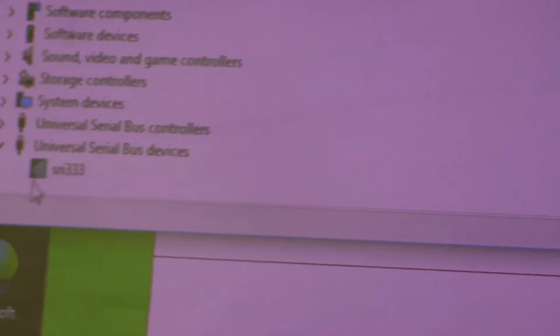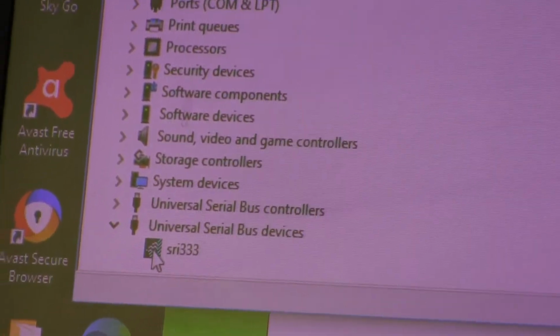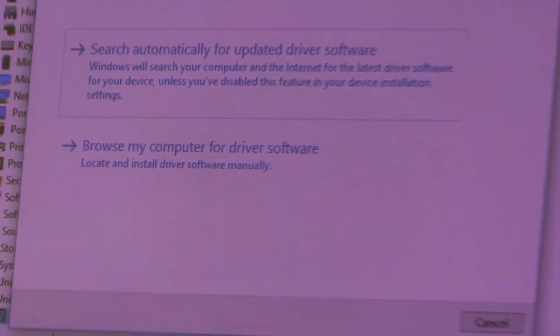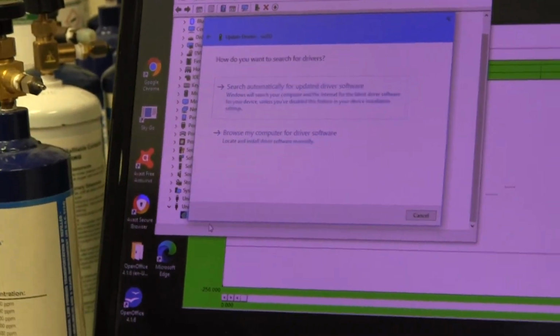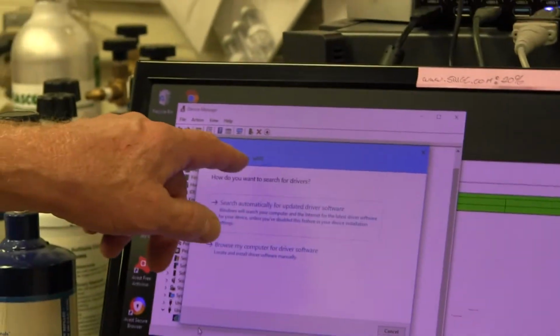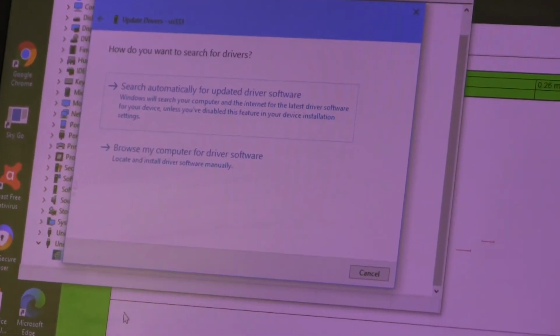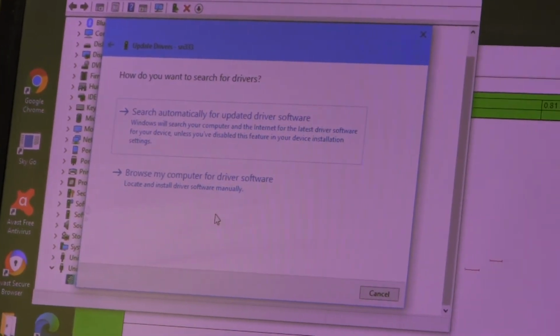So if it looks like this, it means the driver was loaded correctly. If there's a little yellow triangle in front of this, it means there's a problem. And then what you have to do is right-click on that icon and click Update Driver. So sometimes, depending on Windows' mood at the moment, you might have to click a couple of different things to get to a box that lets you update the driver. But that's where we want to go. We want to update the driver if there's a yellow triangle in front of that SRI word.